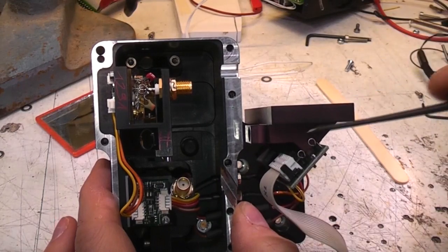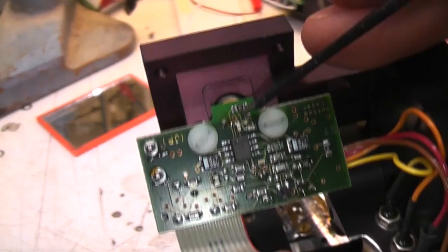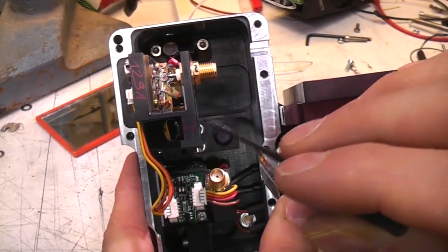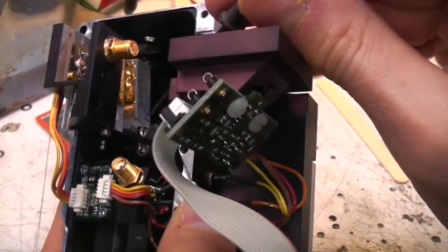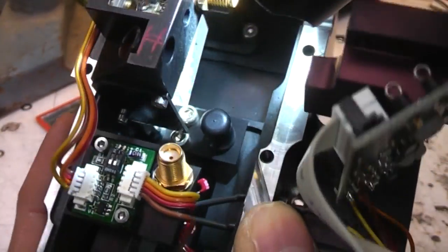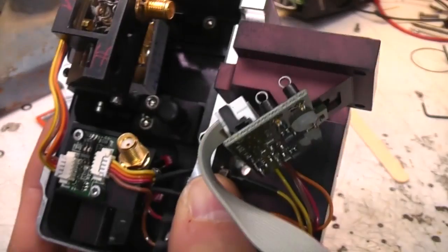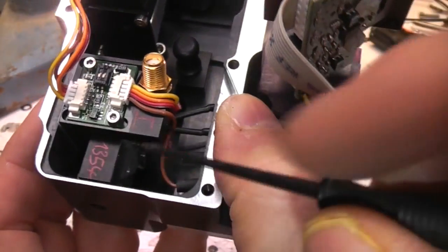Basically the beam comes in here, gets reflected at right angles, and on the back of here there's a photodiode, so that's monitoring the beam power coming in. Then it goes across here, hits this mirror, and then goes down into the unit. And there's another little mirror that's a bit hard to see, it's a fairly small wedge down there, which reflects it downwards through this crystal.